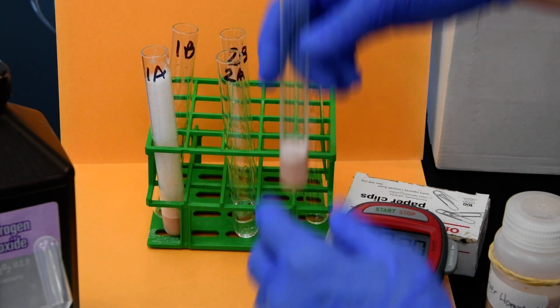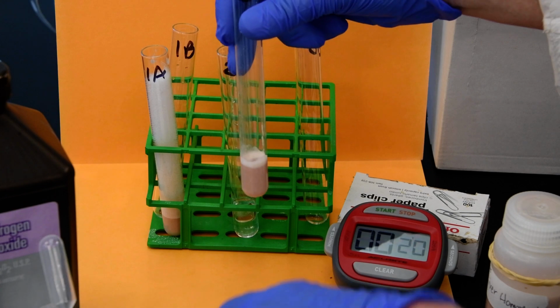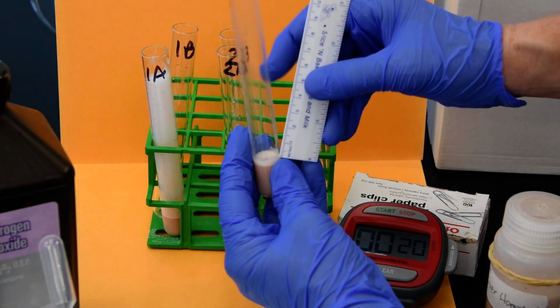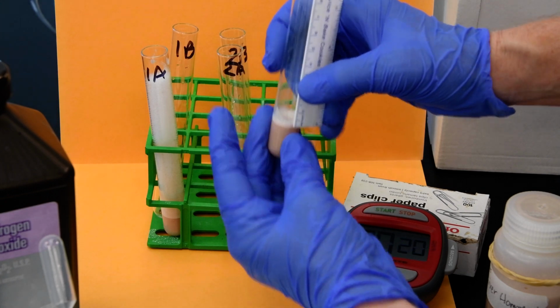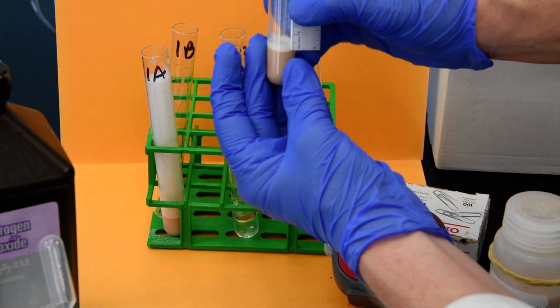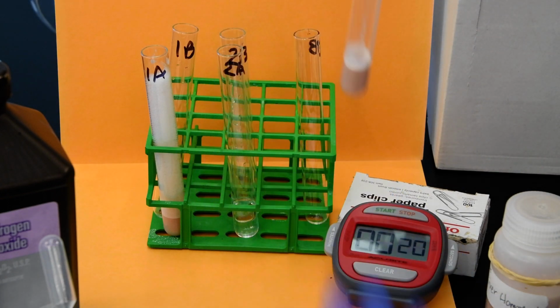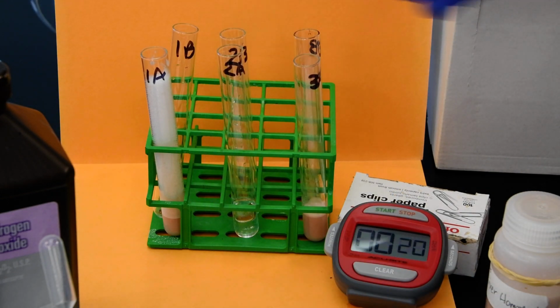All right. And really nothing much. I mean, there's some residue probably from things that were in the liver itself, but for all intents and purposes, we'll call that 3 millimeters. 3 millimeters, to be fair, to be scientific.